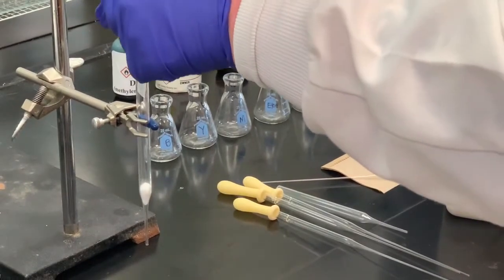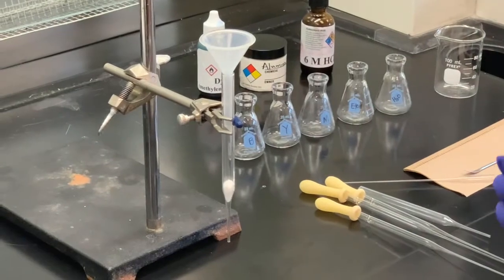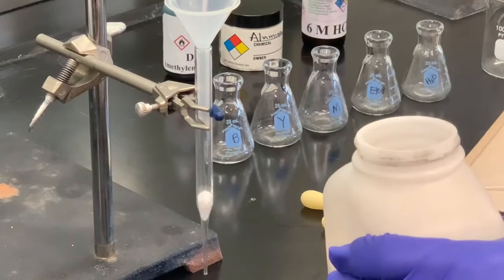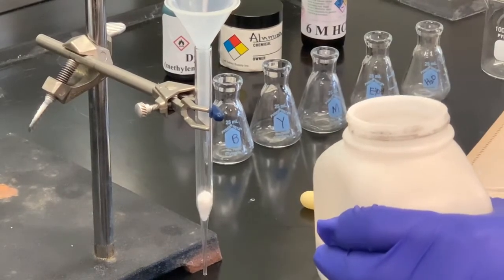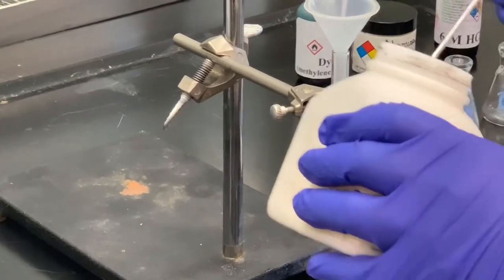And it's probably a good idea to use a small funnel to do this. I noticed under the fume hood, the movement of air is so great. Things that are especially fine particles tend to go all over the place.